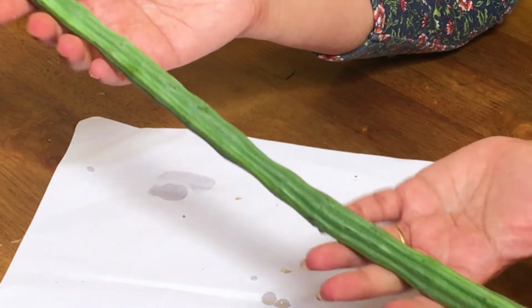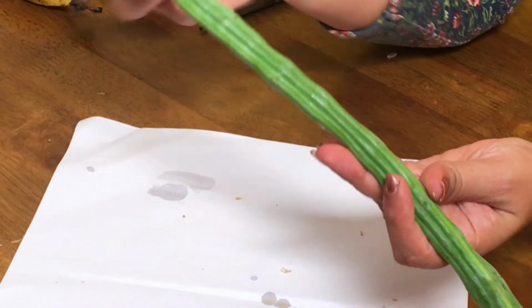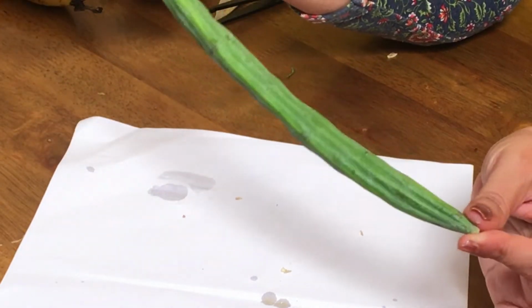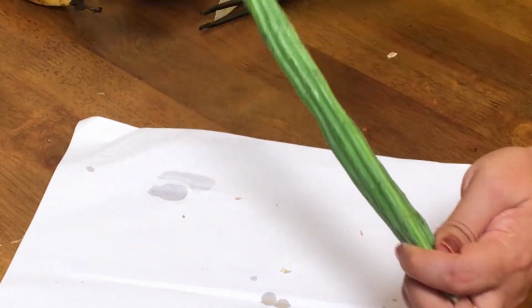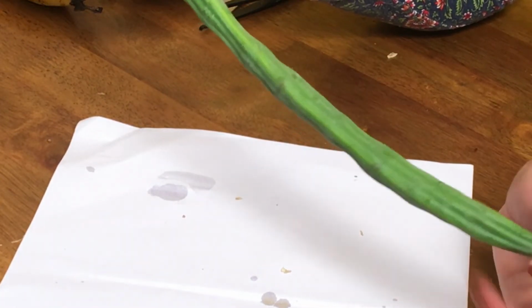Most of my friends have told drumstick is a stem, but it's not a stem. If you cut open the drumstick, you can find a seed, right? So definitely it is a fruit, and it's a simple fruit. Why? Because this is ovary. This is a very long ovary. The ovary has elongated and become like this, enclosing the seeds, and it is formed from a single flower.